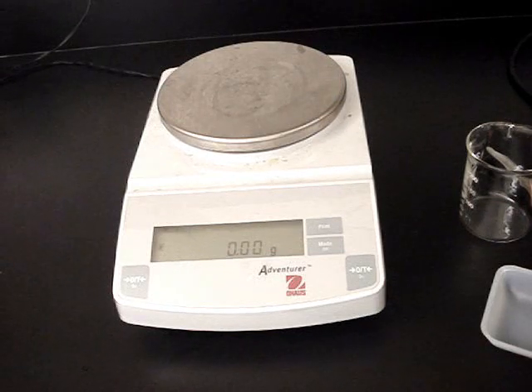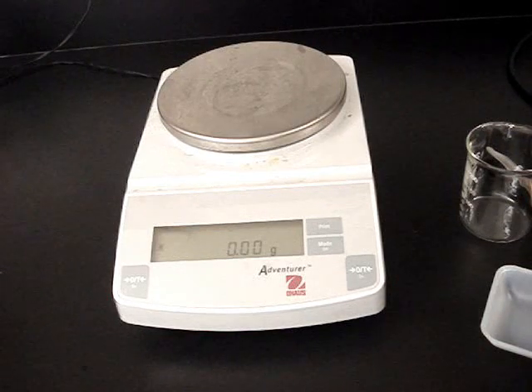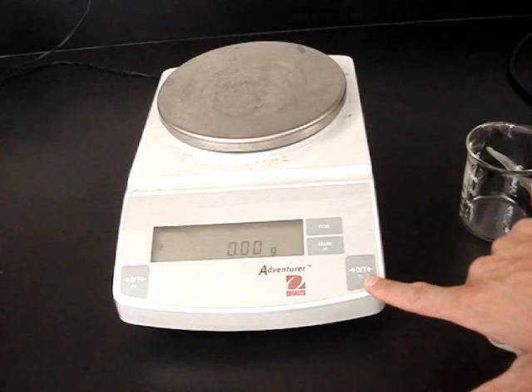However, they're often one of the biggest sources of error in labs, mostly because of the misuse of the tare button that'll subtract the weighing dish. The tare button is located right here on these particular balances.